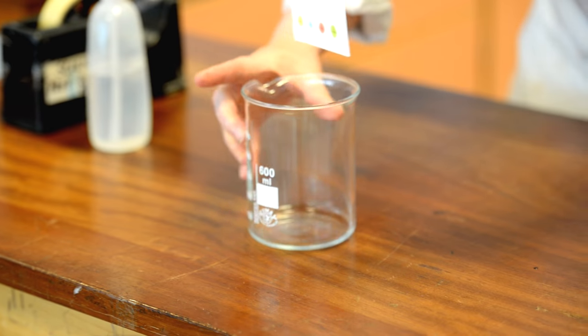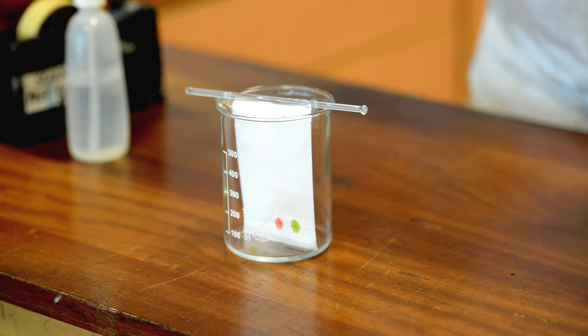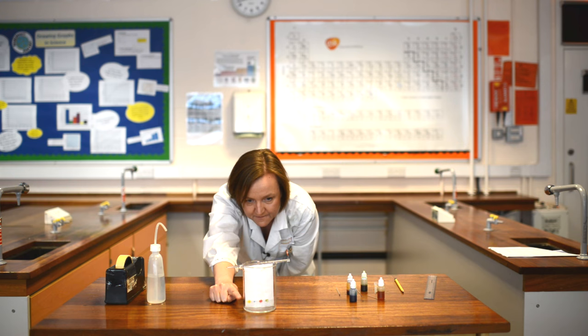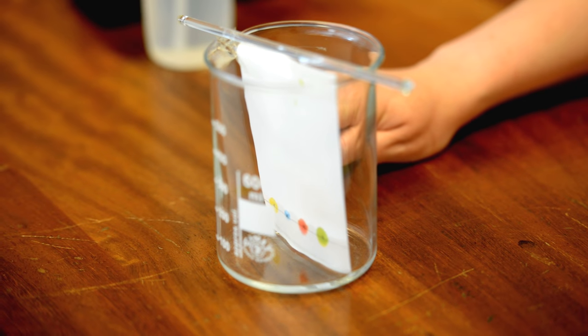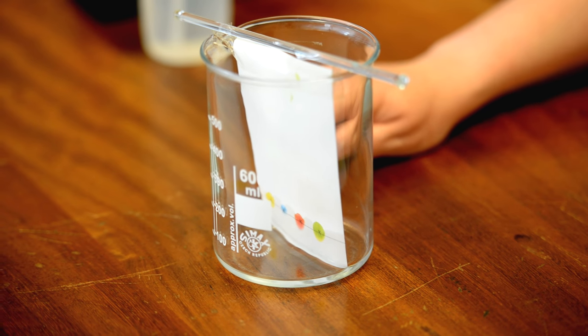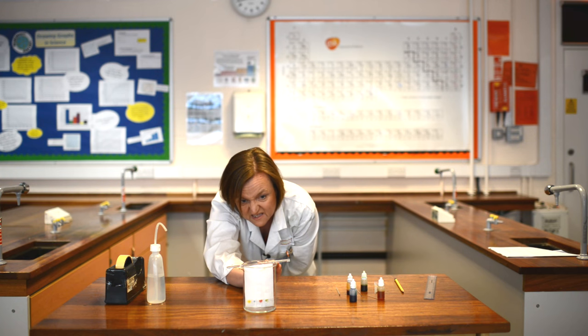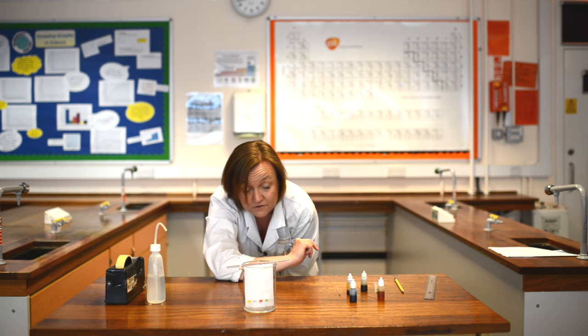So I just stand my paper into the top of my beaker, and now just the very bottom edge you'll see the water level starting to rise up the paper. As it does so it will take the colors with it. We're going to leave it now for a few minutes until the water level has risen to within a couple of centimeters of the top of the paper.